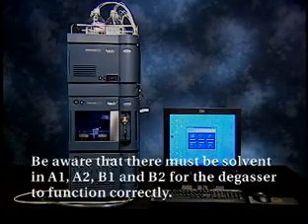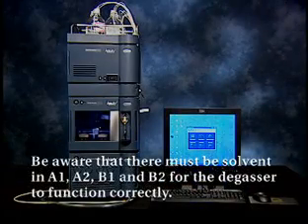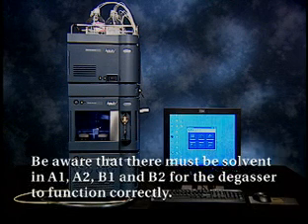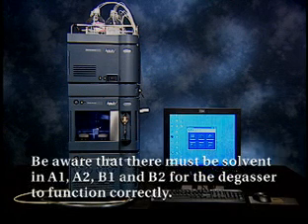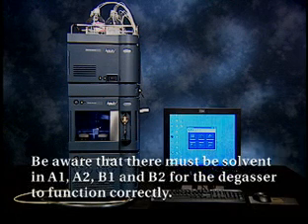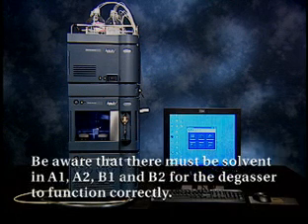Be aware that there must be solvent in lines A1, A2, B1, and B2 for the degasser to function correctly.